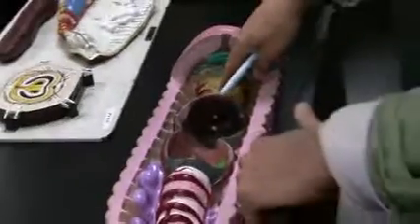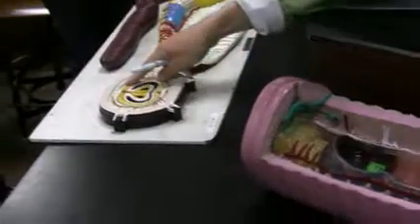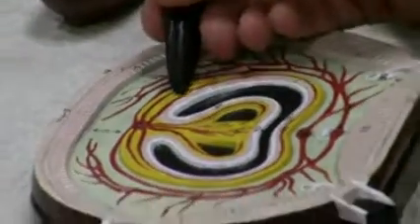So the chloragogen is just the thing on top of the intestines, correct? Mm-hmm, but if you ask for what structure, is it going to be chloragogen or intestine? Chloragogen. Okay. If I want intestine, I'll put a piece of tape all the way from here to here. If I want chloragogen, I'll just put the pointer right there. Say, what is the name of that structure? Not the blood vessels, but the chloragogen. And if you want to ask for typhlosole? Typhlosole, I'll put a piece of tape from here to here. Okay.